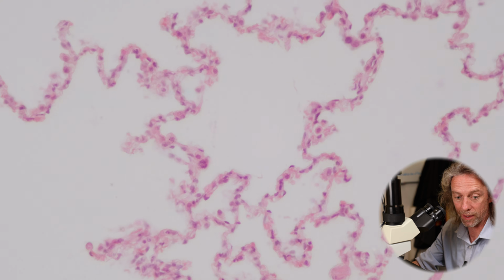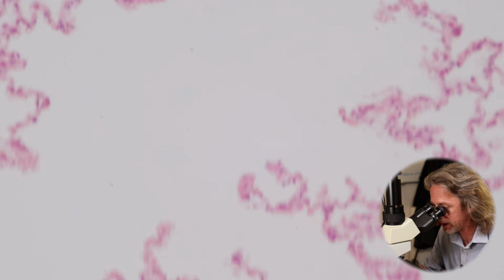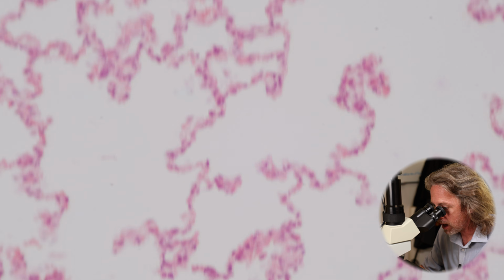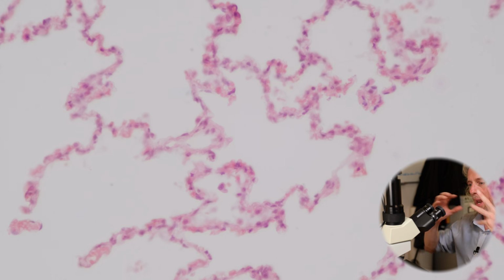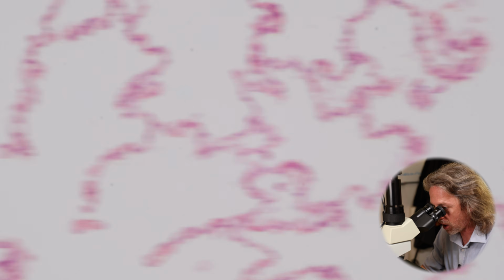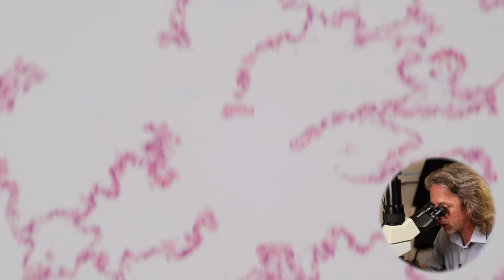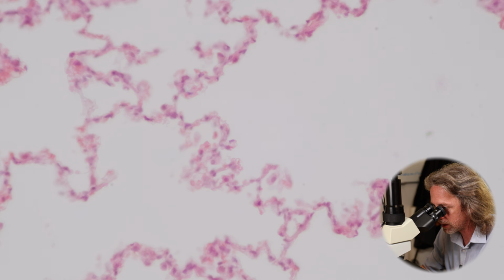So the macrophages are clearing up anything that gets past the mucociliary escalator and gets inhaled all the way down here, which is usually a bad thing. In the cadaver, when we look at a lung, the lung has often got a black speckled pattern, and that's those macrophages. If they've taken up carbon particles and then they get stuck in the lung, that gives us the black marbling pattern that we see in the cadaver.